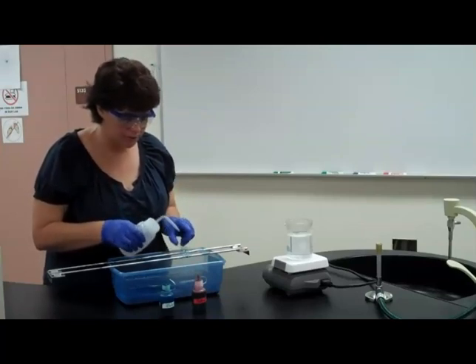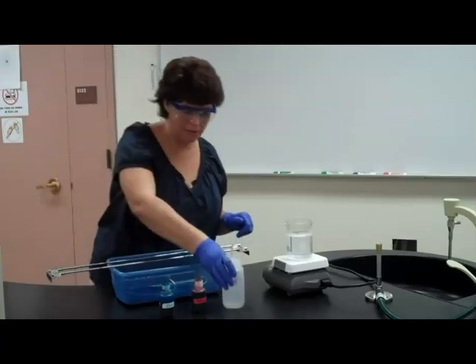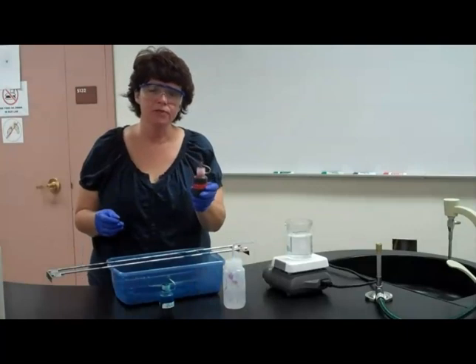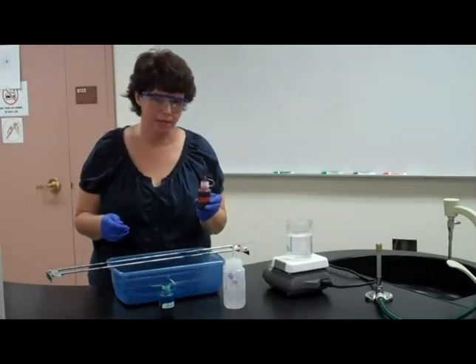So rinse them really good like we've already. Once again, don't be afraid to rinse, rinse, rinse. You can't really over rinse. We're going to go immediately to the counter stain, which is safranin. You saw safranin as the counter stain in the gram stain.